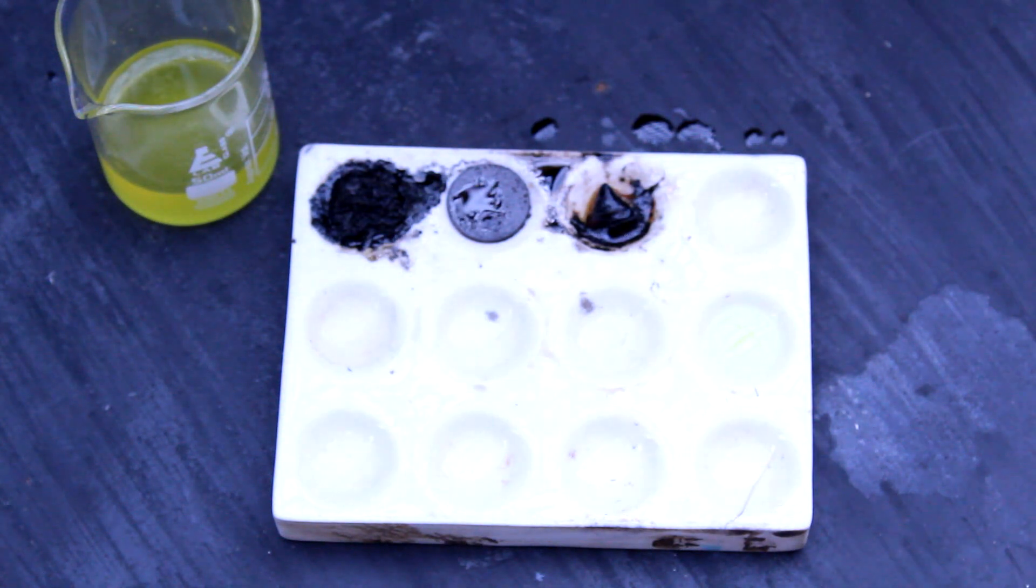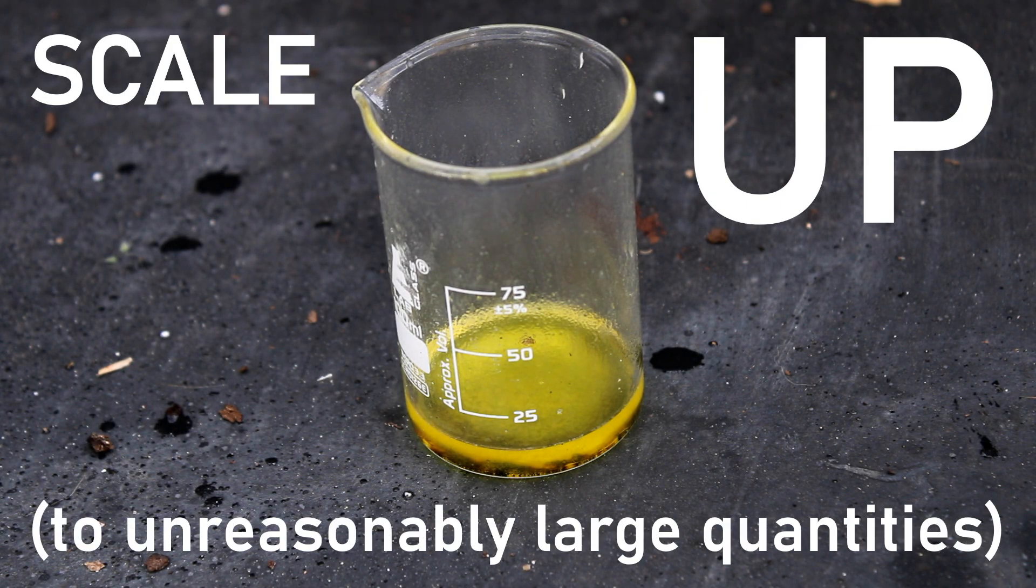But instead of playing it safe and ending the video on a boring note, I decided it was time to do something that I'd classify as moderately stupid. That's right, it's time to scale up to unreasonably large quantities.